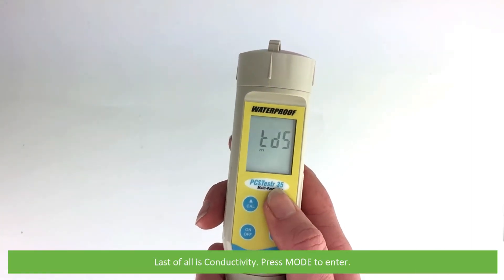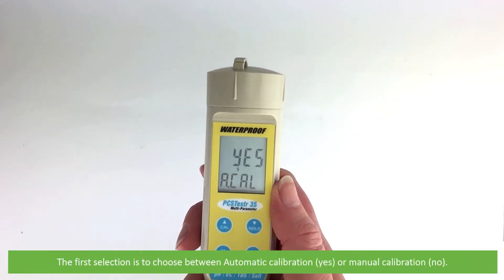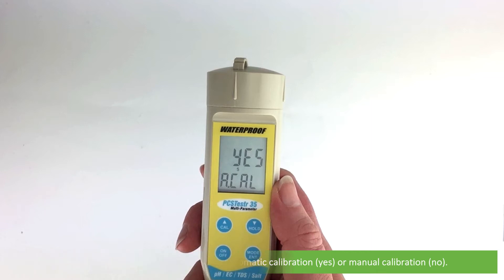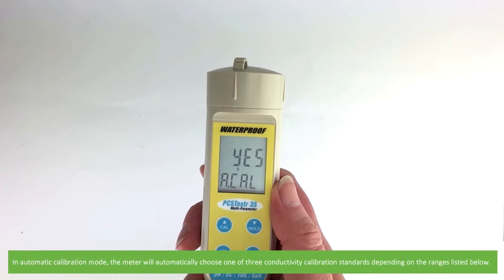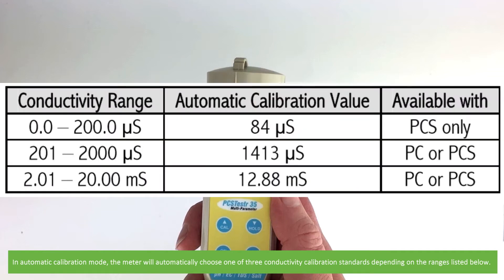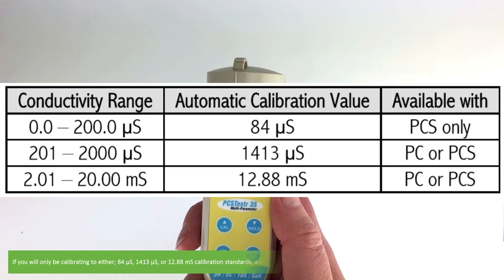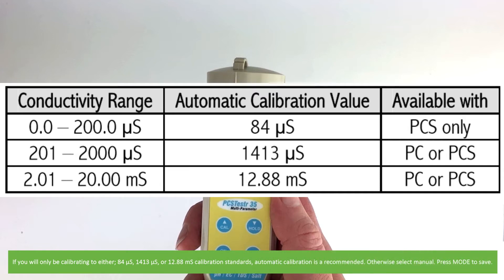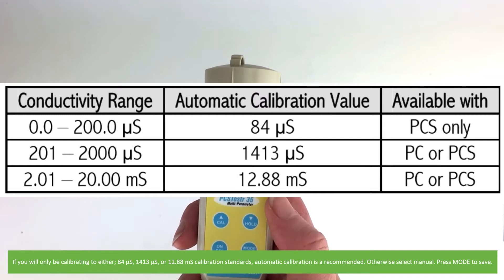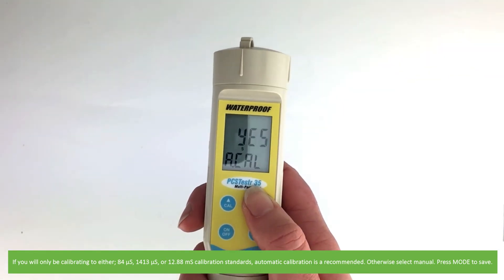Last of all is conductivity. Press mode to enter. The first selection is to choose between automatic calibration, which is yes, or manual calibration, which is no. In automatic calibration mode, the meter will automatically choose one of three conductivity calibration standards depending on the ranges listed on the screen. If you will only be calibrating to either 84 or 1413 microsiemens per centimeter, or 12.88 millisiemens per centimeter, automatic calibration is recommended. Otherwise select manual. Press mode to save.